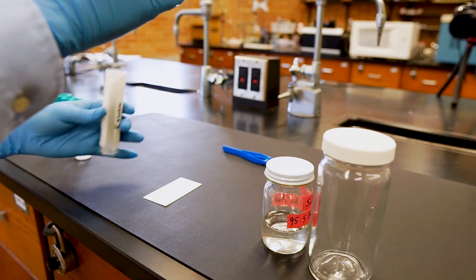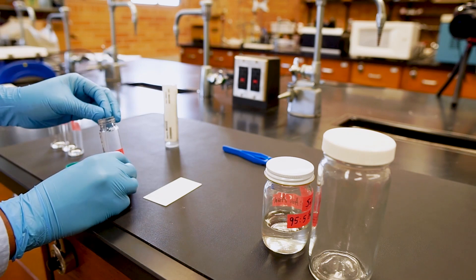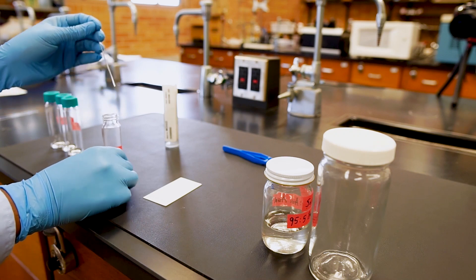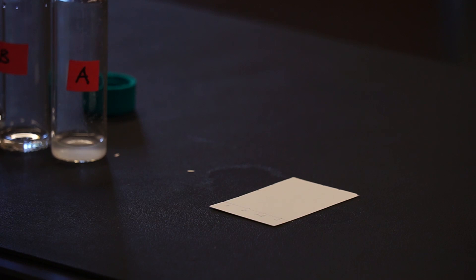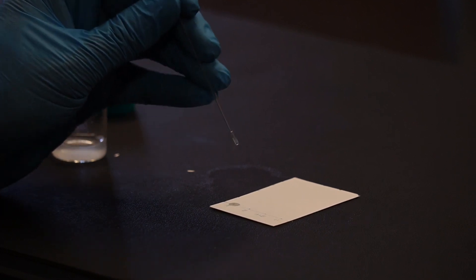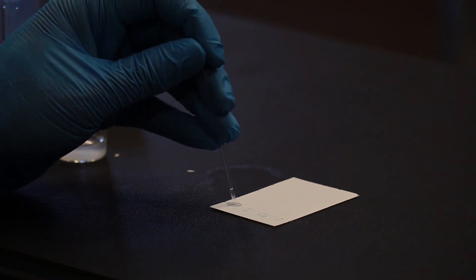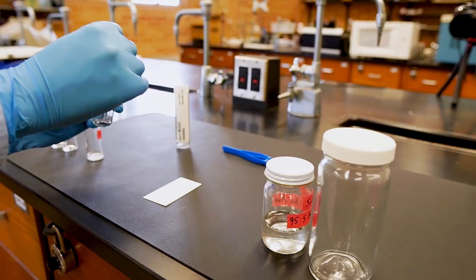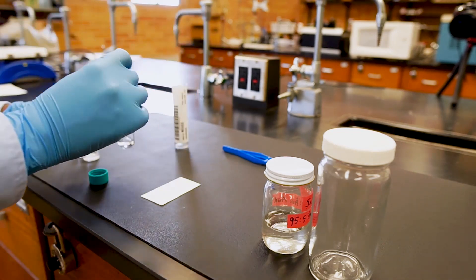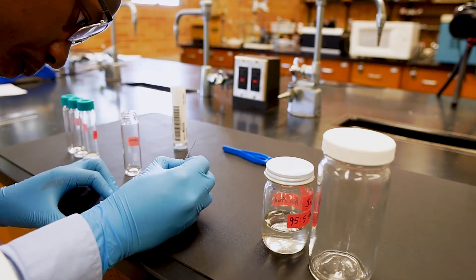Now it's time to load the samples. To do this, let's use a microcapillary tube. Dip the tube into the sample and wait for a bit — you'll see the liquid travel upwards due to capillary action. Then take the tube and spot the plate with the sample. On the corresponding dot, briefly tap the tip of the microcapillary tube about three times, but make sure you do it gently so that you don't scratch the silica layer. You also want a small sample to maximize the resolution — do not let the sample spread out too much. To spot the other samples, make sure you use a different tube to prevent cross-contamination. Also make sure that the spots do not bleed into one another — we want them completely separated so that the results are unambiguous and easy to read.